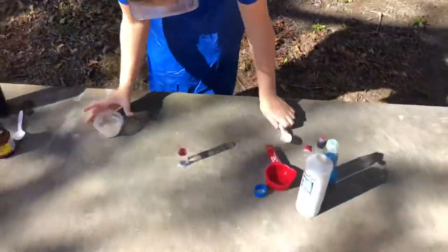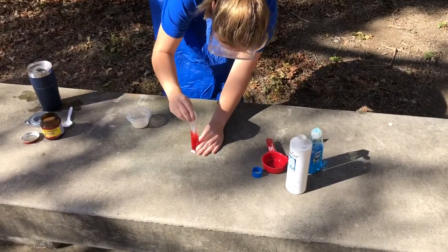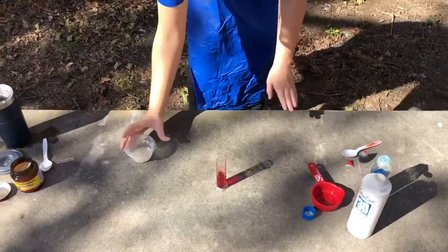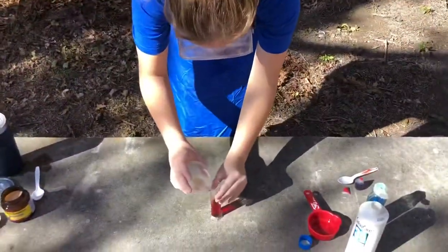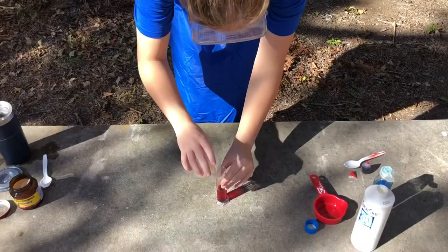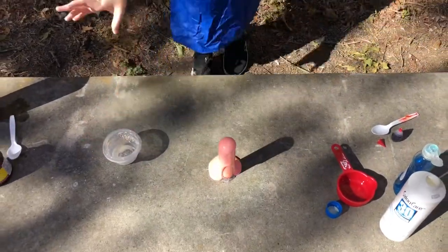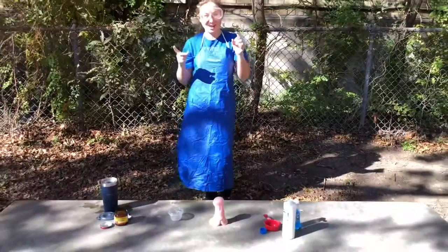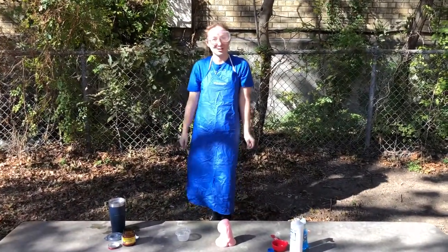Now we're going to mix this up before we add the yeast. And now we're going to add the yeast and watch as the elephant toothpaste hopefully will be made. And there you have it — there's our elephant toothpaste. I will be right back to show you how to calculate the bond energies and the total energy change.